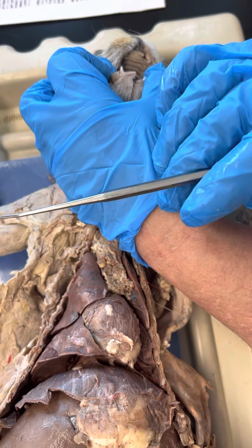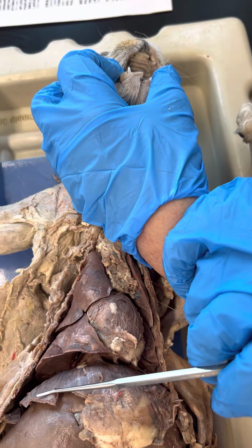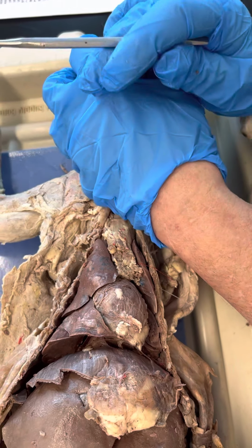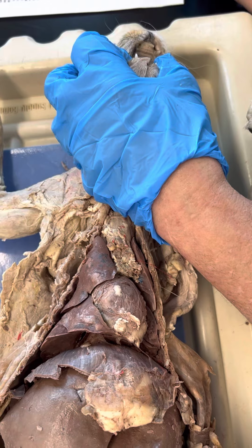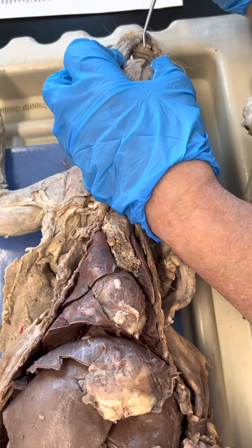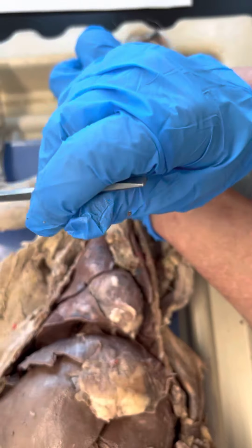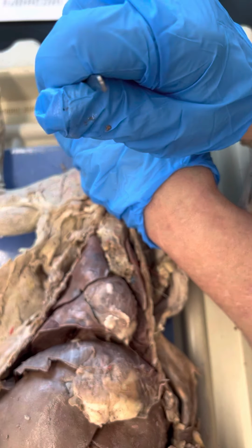Where's the sulcus? What's a sulcus? In the brain, it's the crease, but they have it on the tongue too, and it means the same thing. On your tongue, where is there a sulcus? Right down the middle. It's the thing that runs right down the center. All these words are similar, so you can just pull them all together. Lingual frenulum, we can see.